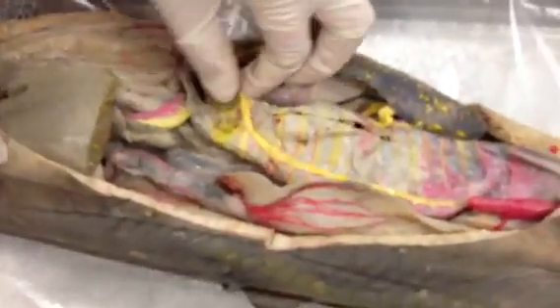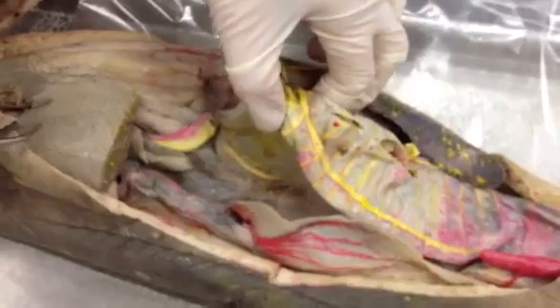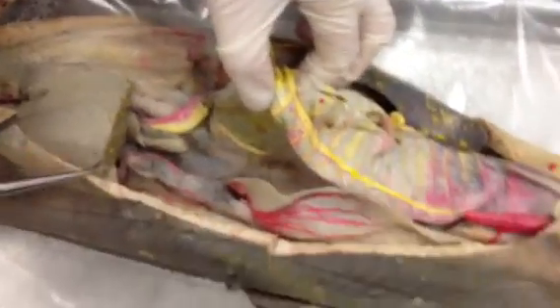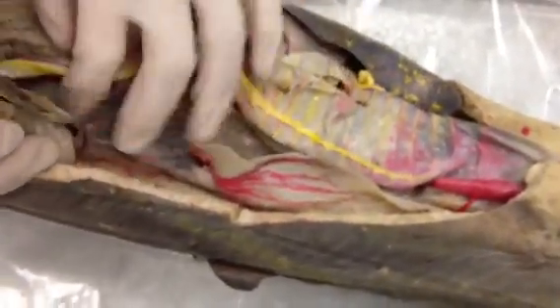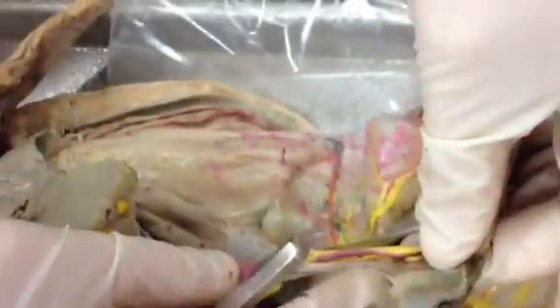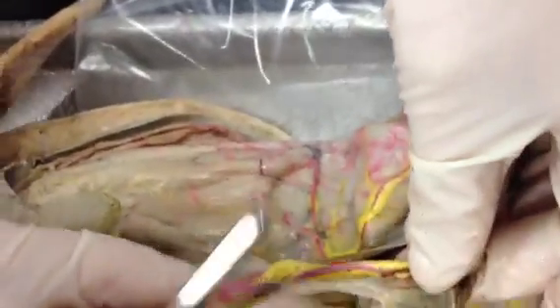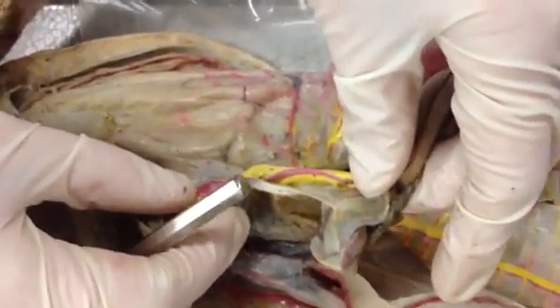For the lesser omentum, it is also called the gastrohepatoduodenal ligament, and it has two different branches. It goes from the liver to the stomach. You can see this omentum that comes from the bile duct, and then it branches here and here, and all of those are part of the lesser omentum.